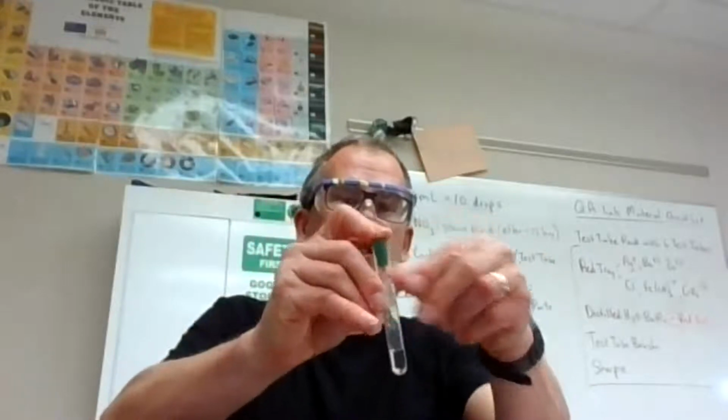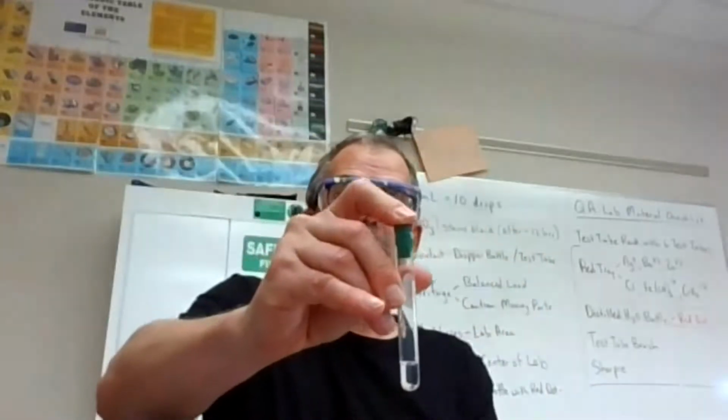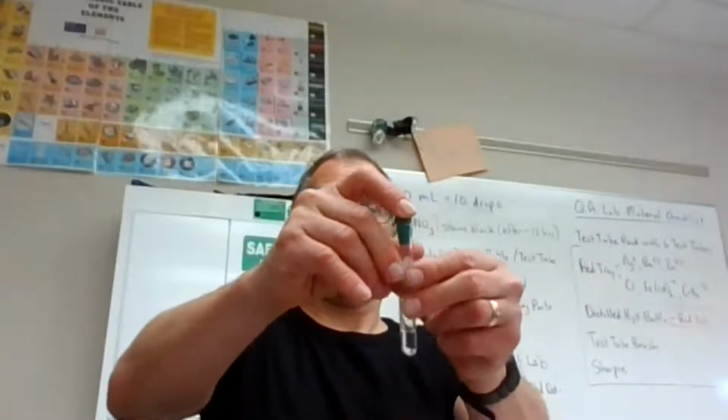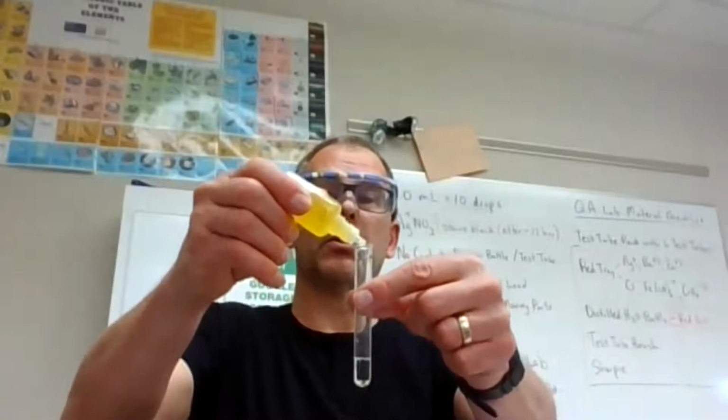I don't see anything happening. I'm going to give it that inversion mix though, because sometimes you see some cloudiness and then you get that gel-like fish egg type thing. And I look and I don't see anything there. So I'm going to go right to my next step. And that is adding CrO4 minus 2.